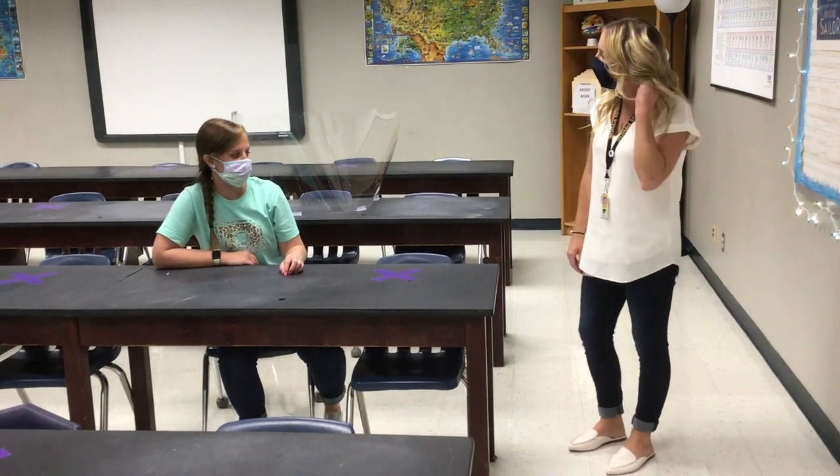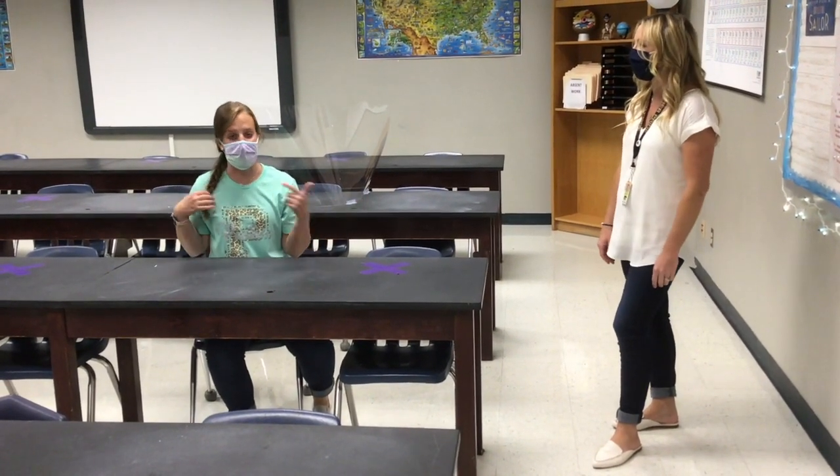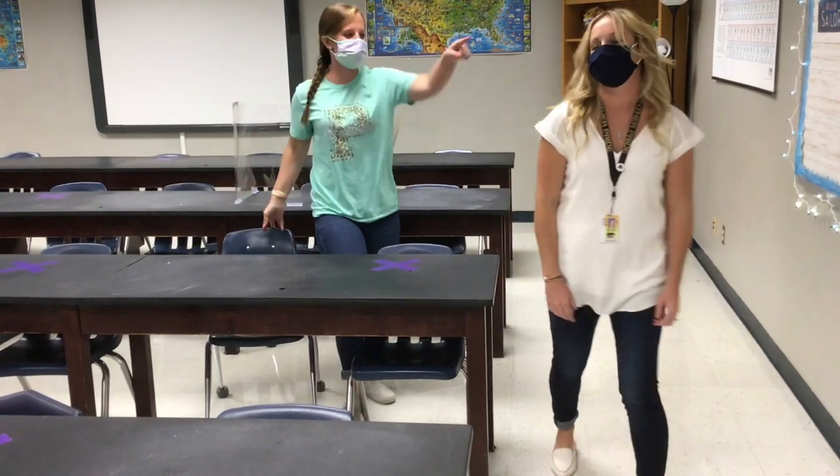Damn, I forgot to put my hair up today! And I'm wearing sandals! That means I can't participate! Well, my hair is up, and I got my band on today! Ha! No participation for you!